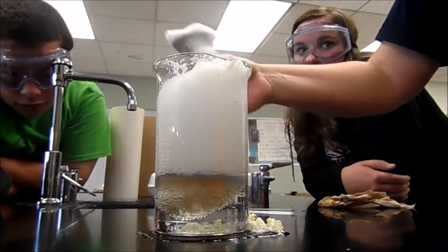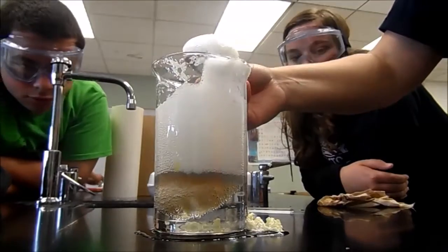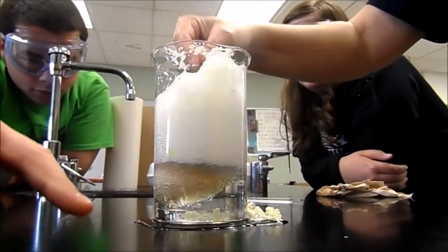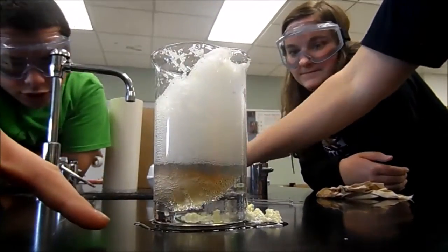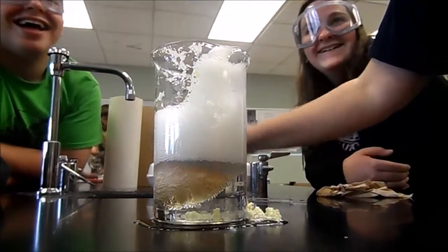That's crazy how much water is in it. I know, I didn't realize that. Are you sure? Its water broke. You're not funny.